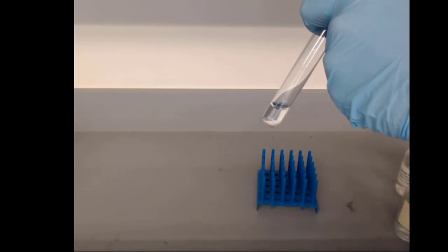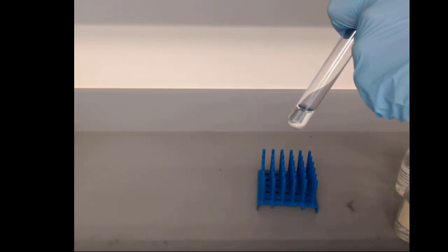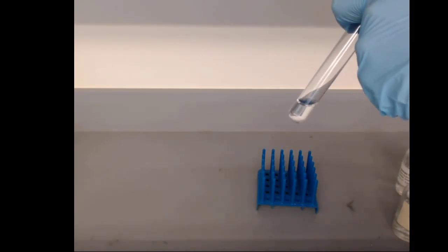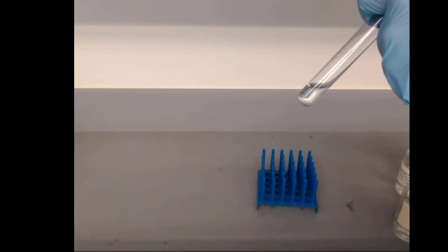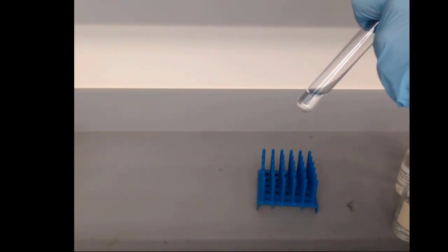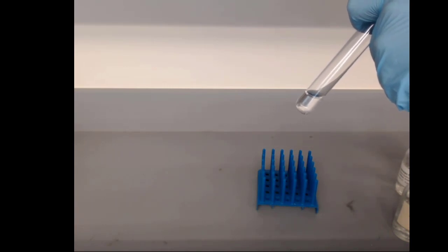Now, think to yourself, have you ever seen an iodine solution? Have you ever seen places where they use it? Do you have an idea of what this should look like? If you've ever given blood and they've rubbed that kind of brown liquid over your arm before they do that little needle prick, that's an iodine solution.